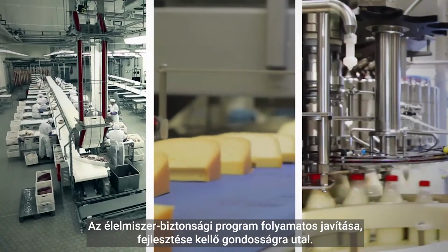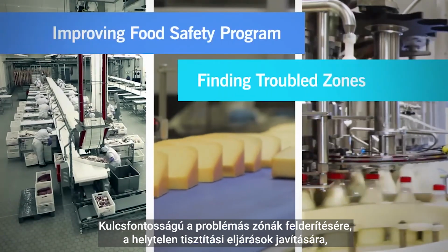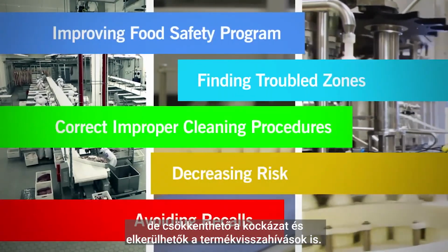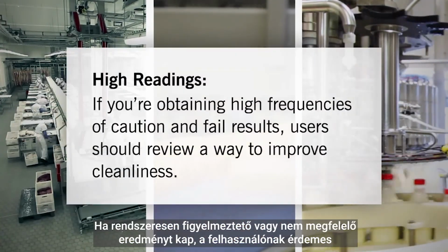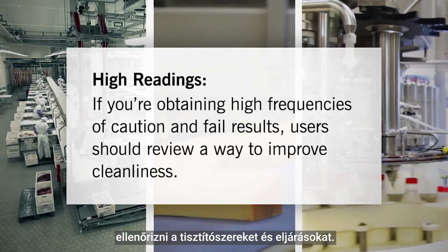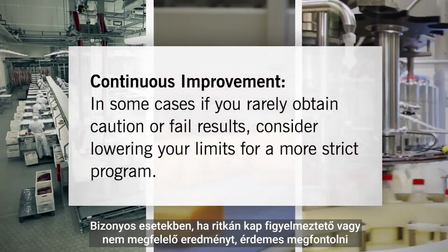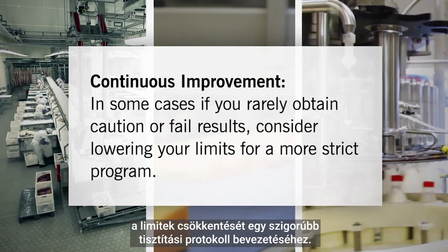Constantly looking to improve your food safety program shows due diligence and is crucial to finding trouble zones, correcting improper cleaning procedures, decreasing risk, and avoiding recalls. If you're obtaining high frequencies of caution and fail results, users should review sanitation materials and procedures. In some cases, if you rarely obtain caution or fail results, consider lowering your limits for a more strict program.